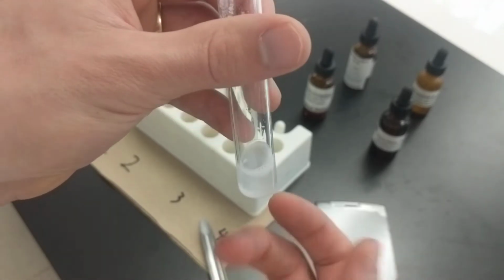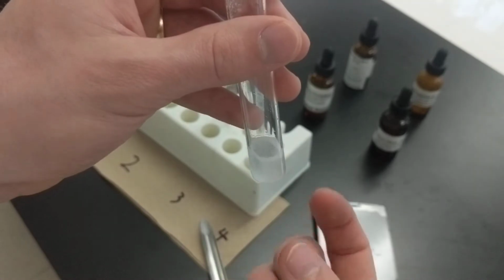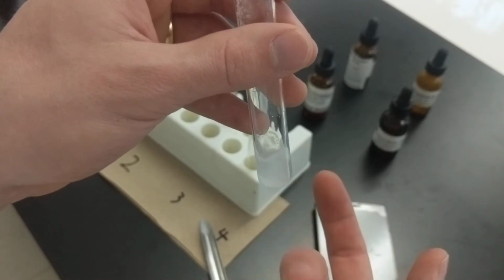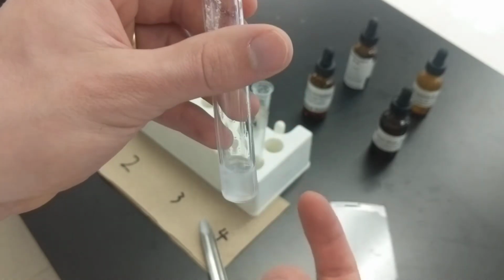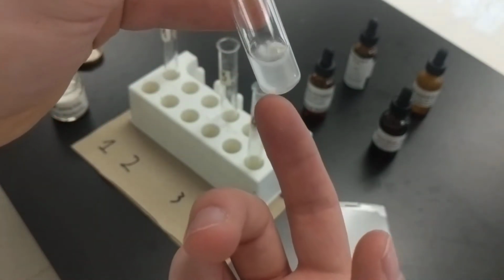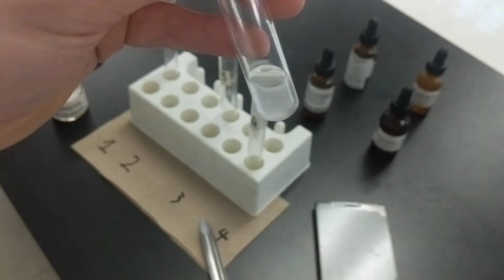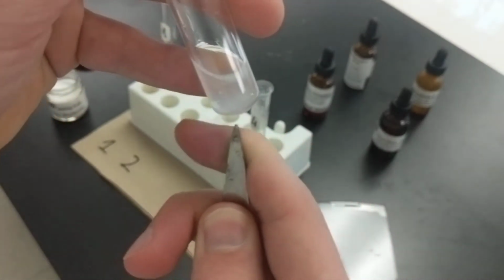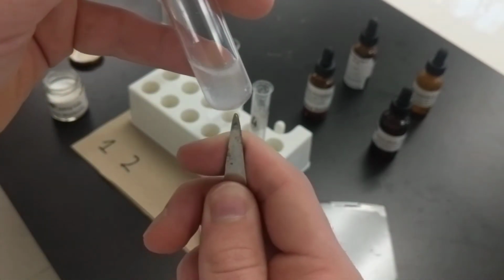This also you're supposed to check for 2 minutes, but I think we'll skip that. By flicking a little bit like this, by stirring it, I'm speeding up the process so we can see it a little bit faster. So you can tell that there's very, very little baking soda left. I don't know if you can see that, but there is a tiny bit left at the bottom, but not very much at all.